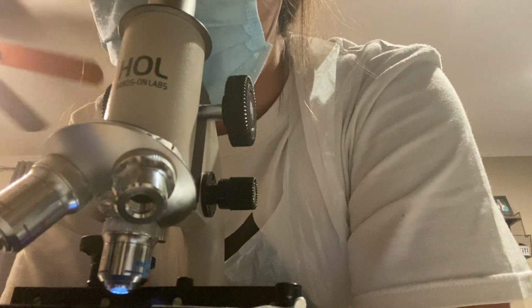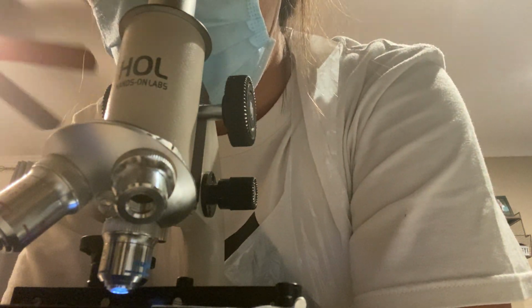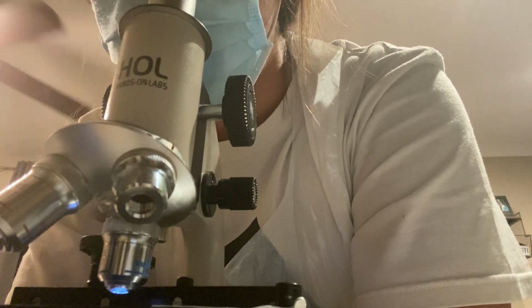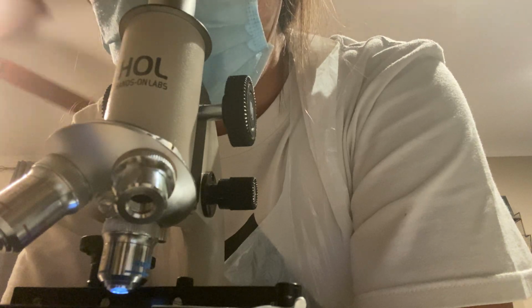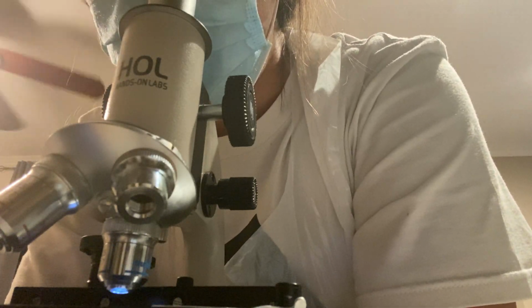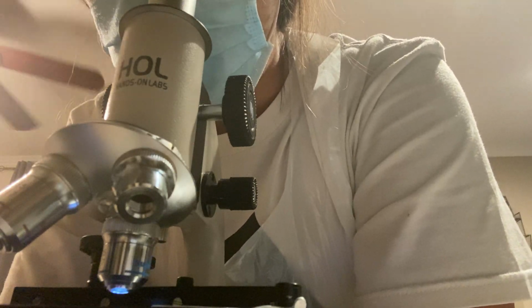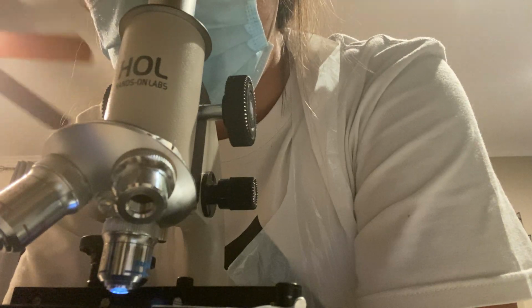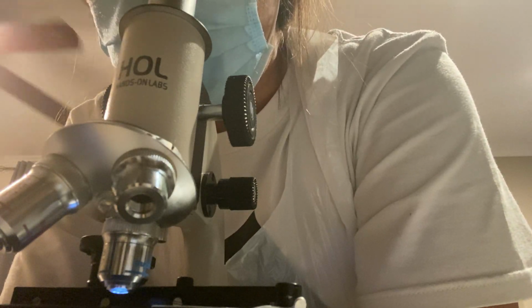Just really small ones, or possibly even, I'm not going to say elongated, I don't see those ones. Maybe even the Spirilla bacteria, because the way they're arranged, it almost looks like clusters forming and making kind of a pattern.